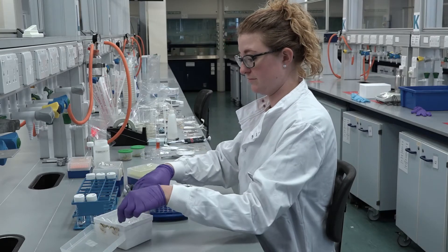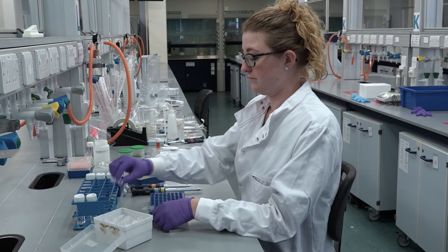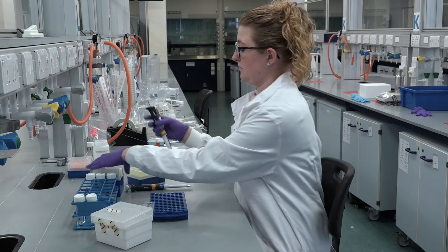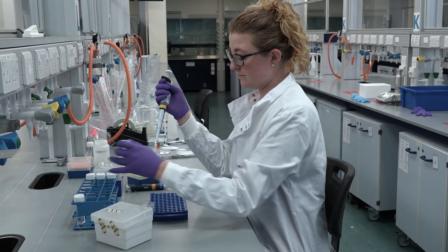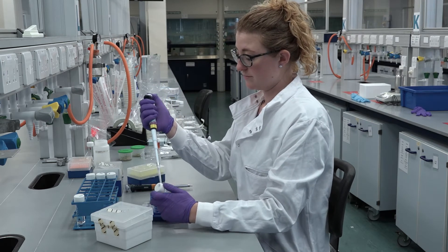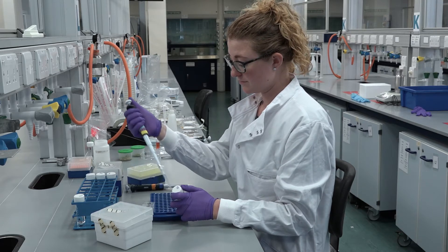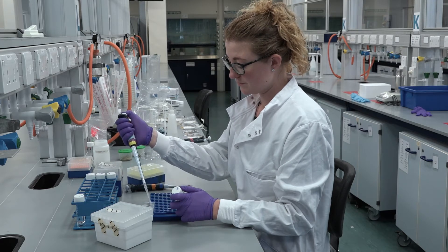Calculate the amount of antibiotic used clinically on a mg per kg basis and scale for the larval weight. In this example, 50 mg per kg of tigecycline is used clinically. Assuming a typical weight of 0.3 grams per larva, we will dose each larva with 15 micrograms. Prepare antibiotic dilutions scaled according to the weight of the larvae.